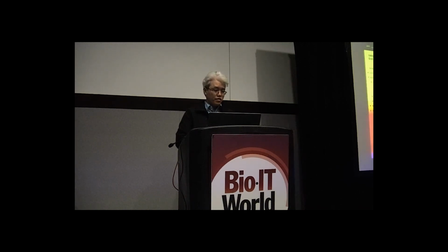I'm going to show how I do this in demo mode. If you have your AWS console open, and you've never used it before, you might see a blank page. To find Omics, you can go to Services and scroll down, but the easiest way I like is the search function up here. Click the magnifying glass and type Omics, and it should be the first hit. I'm going to open that up.